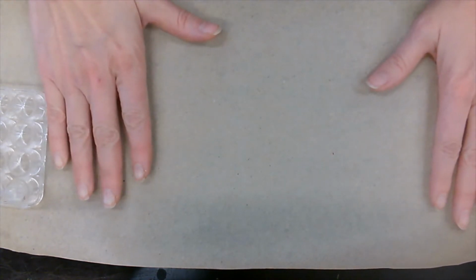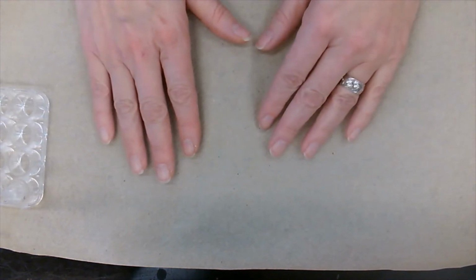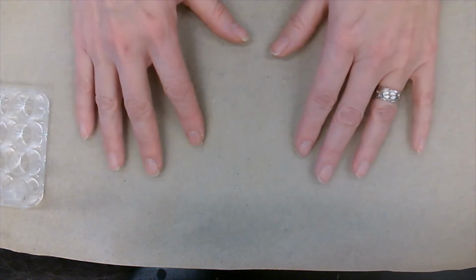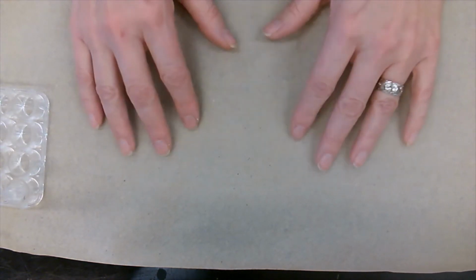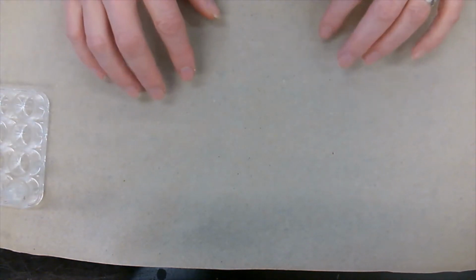The tests that we're going to be performing are litmus paper tests, so the red and the blue litmus paper test. We're going to be testing for electrical conductivity as well. And finally, we're going to be testing for cobalt chloride. Okay, let's start out with our first test.